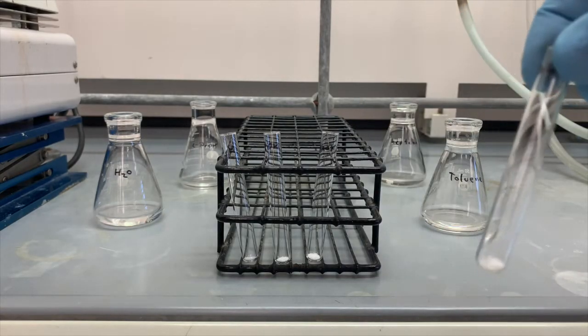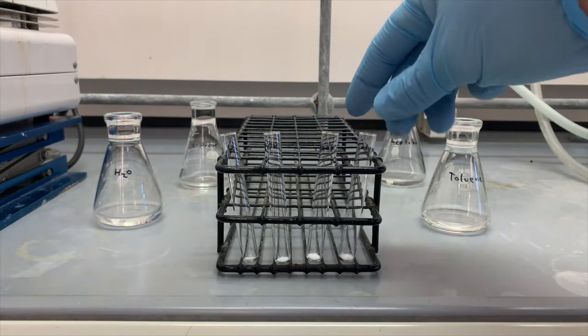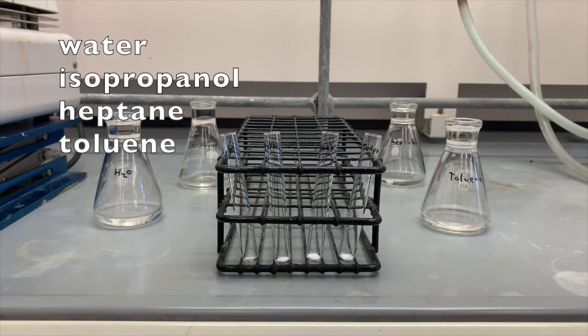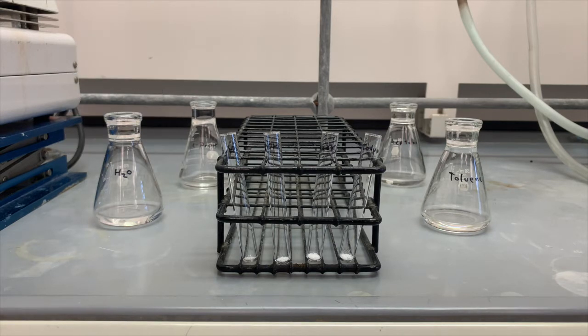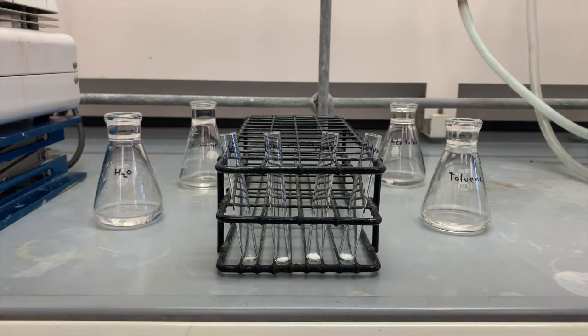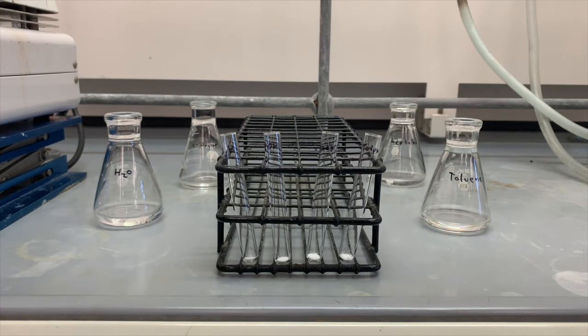All right, let's get to work. In a previous episode, we performed an extraction and we got a nice white solid, which is the acidic material, and we placed it in this filter paper wrap. Today, we're going to purify that compound by recrystallization. But first, we have to figure out what solvent system will be appropriate. I have placed 0.03 grams of our organic acid in each of these test tubes, and we will begin by testing water, isopropanol, heptane, and toluene as potential solvents for recrystallization. The first thing we need to do is add solvent to these test tubes and make sure that the solid does not dissolve at room temperature. If it dissolves at room temperature, it's not going to be an effective solvent for recrystallization.